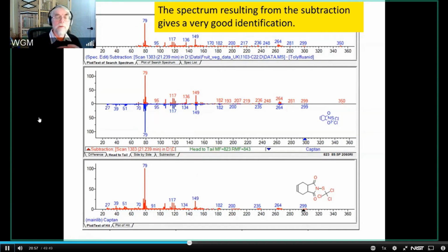So what we have done here, and I'm going to go over this in real time, I'm going to actually do this for you on the screen, is basically gone through the process of having something that we didn't get a very good match for. We were suspicious that there might be a second component there, particularly because AMDIS has told us there's a second component there. And then we've used the NIST search software to give us at least a beginning idea, and probably a good identification, of this particular component. And I'd like to just go through that process, not with slides here, but in real time with the mass spec database.